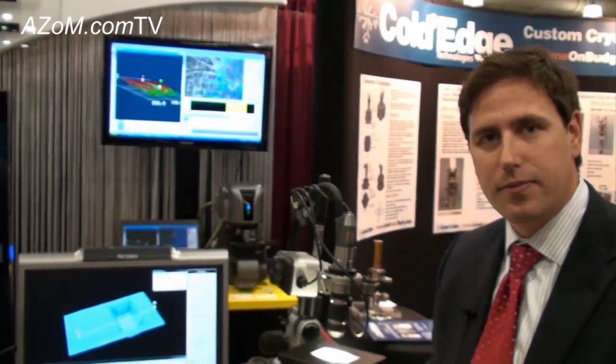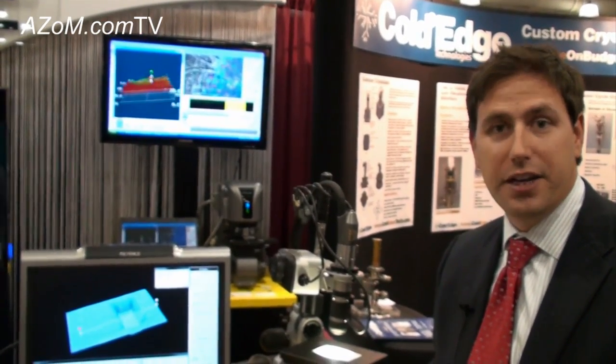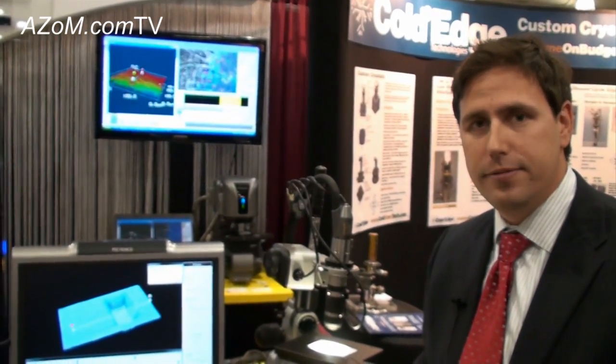What range of magnification does the VHX1000 have? We have a full range from 0.1x, or negative magnification, all the way to 5,000 times magnification. A good way to describe that is we can see from an engine block down to about 420 nanometers.